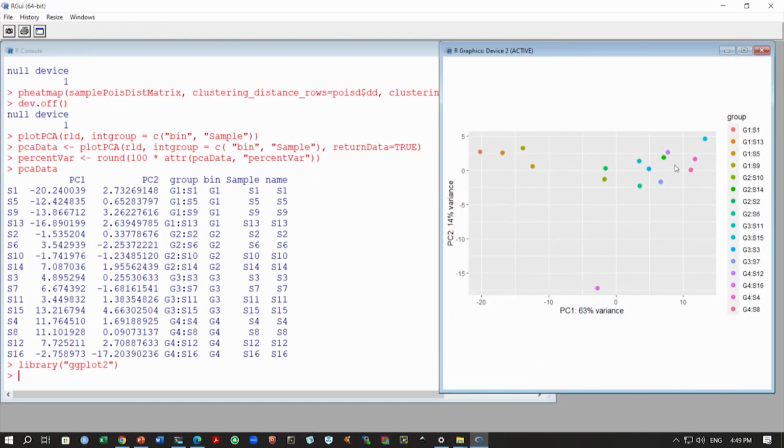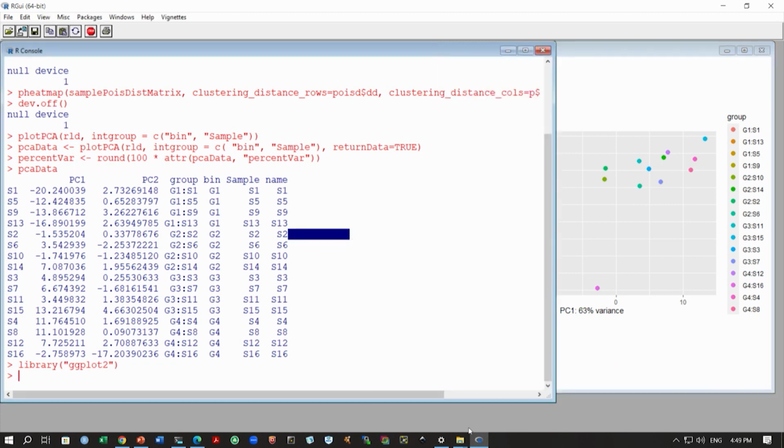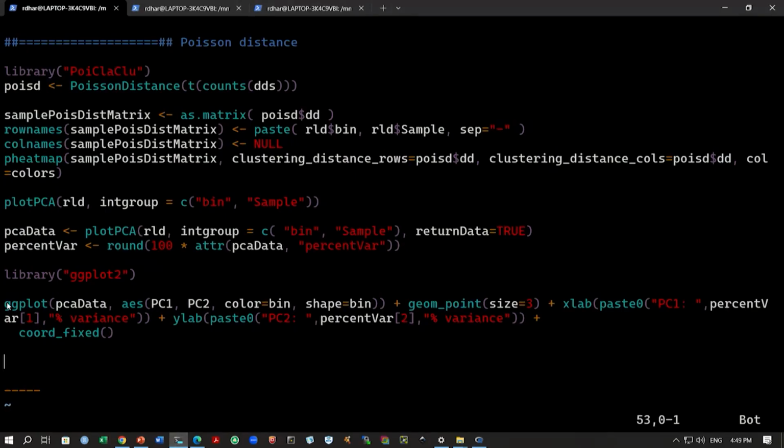So, now we can use this PCA data and percent variance to actually plot this. And you will see we will get a very nice plot, because we want these groups to be colored similarly. You see in this plot, we can say these are the group 1 samples on this side, but maybe if we color them with the same color, it would actually be better, right. So, let us try that with this ggplot2, and the command for doing that is this ggplot. We take the PCA data that we generated. The x axis and y axis will be PC1 and PC2, the first two principal components that explain the largest amount of variation in the data. Color equals bin, so color the points according to the bin, so part of which group they are, and shape of the points should also be according to the bin.